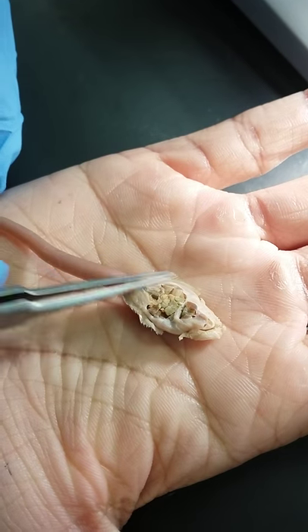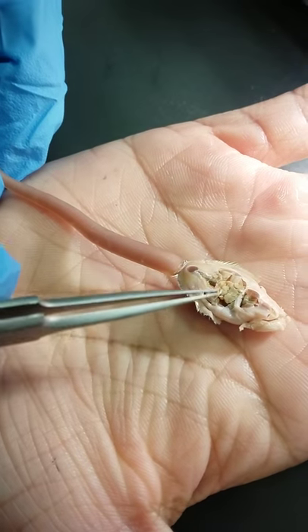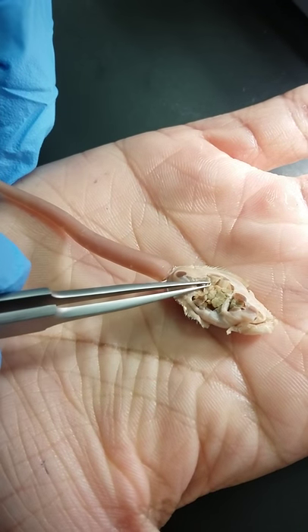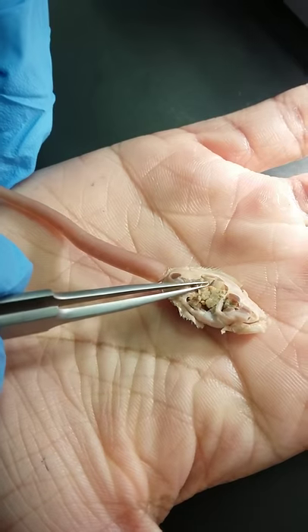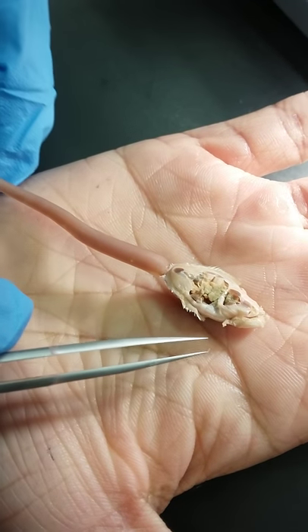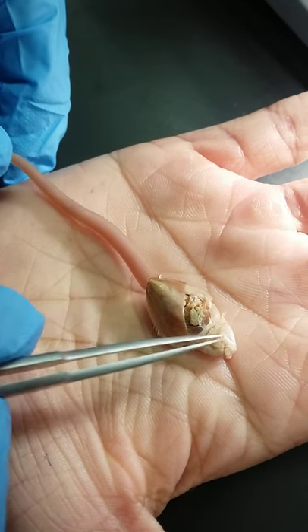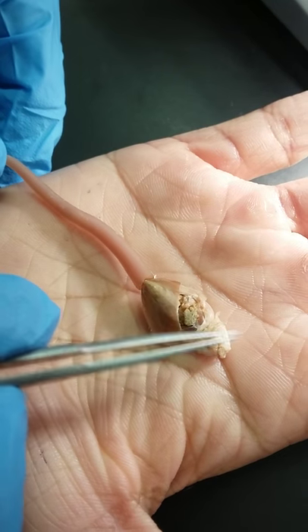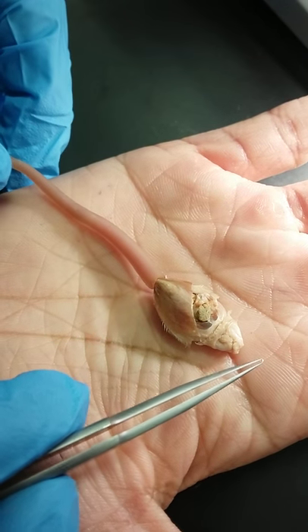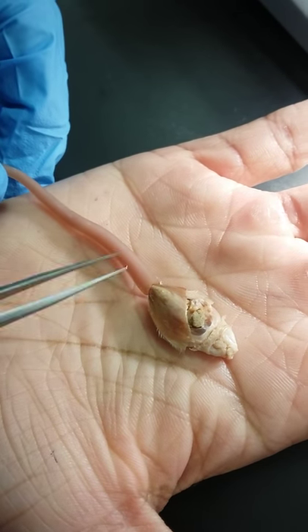The shiny thing right here — these are oblique muscles. And if you turn it around, this is the lophophore, this is the anterior side of the organism, and this is the posterior side.